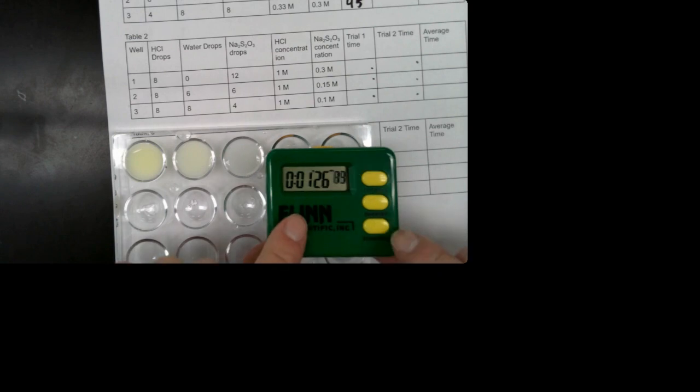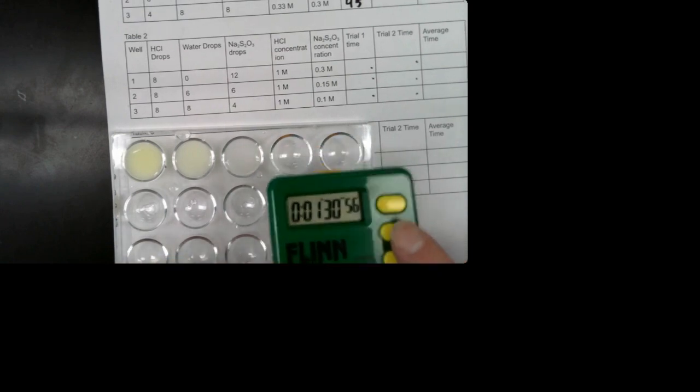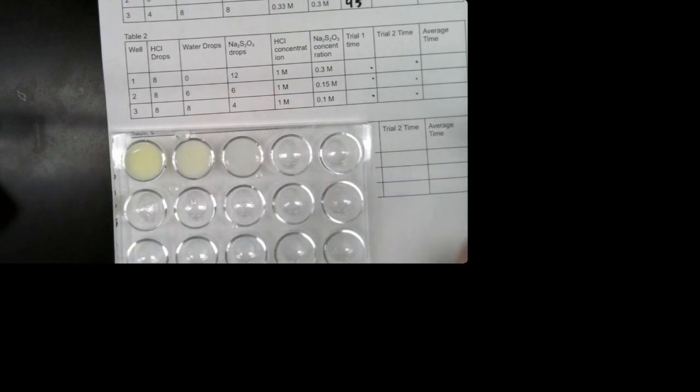Okay, it looks like it disappeared. So let's also talk about how to average. If it's in seconds, we can just add them up. And then because there's 2 of them, we're going to divide by 2. If they're in minutes and seconds, so if this one was like 1 minute and 10 seconds, and this was like 1 minute, I didn't watch, maybe this one was 1 minute.